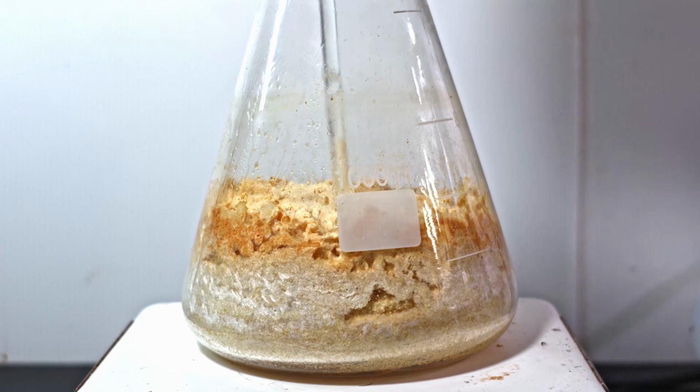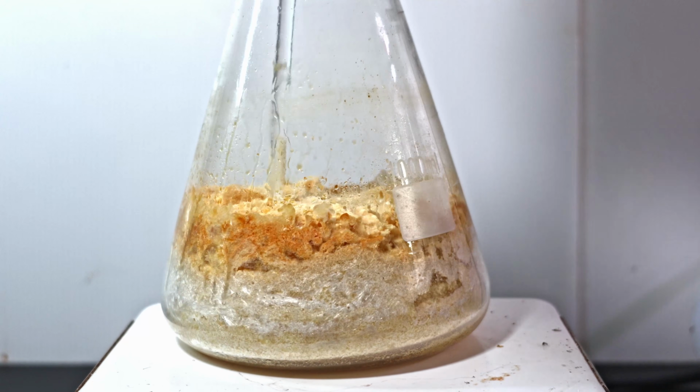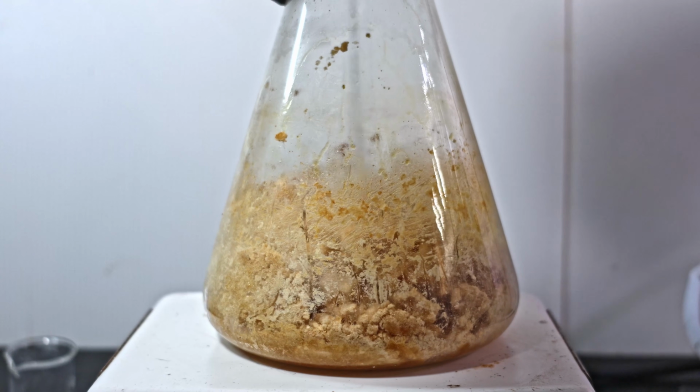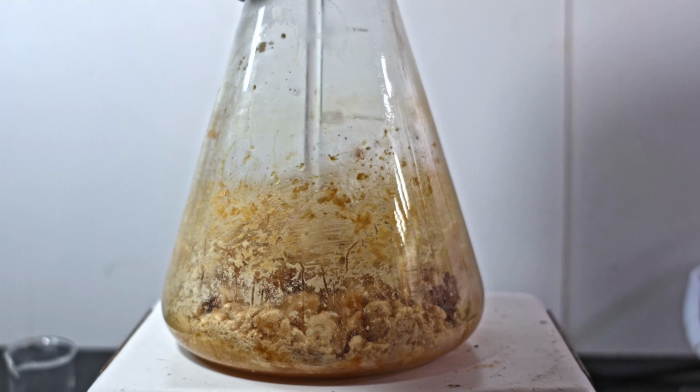In hindsight, I probably should have stopped here. It was brittle enough to pulverize and evacuate. It probably would have burned too and performed a much better Claisen condensation. At least we all learned something in this uncharted episode.